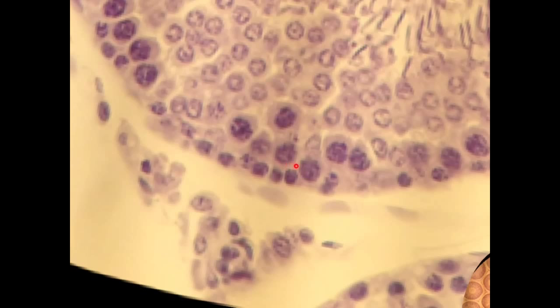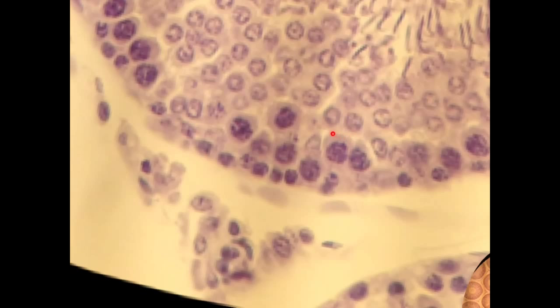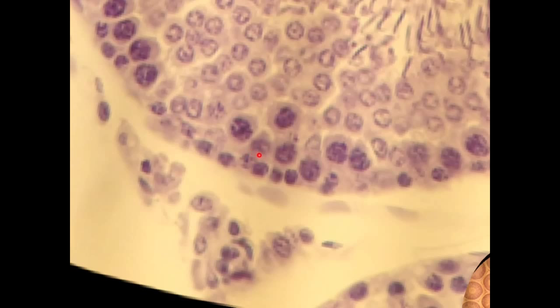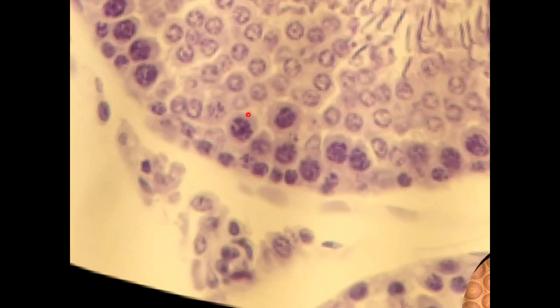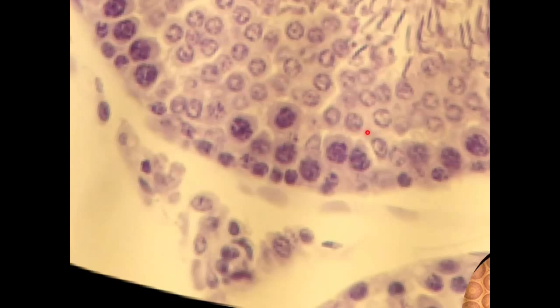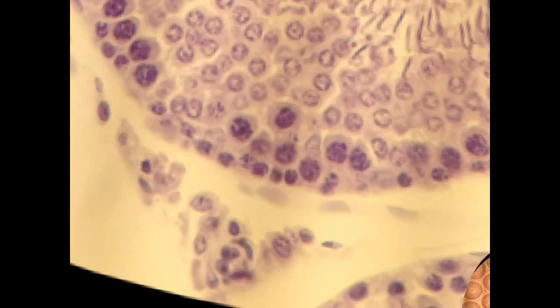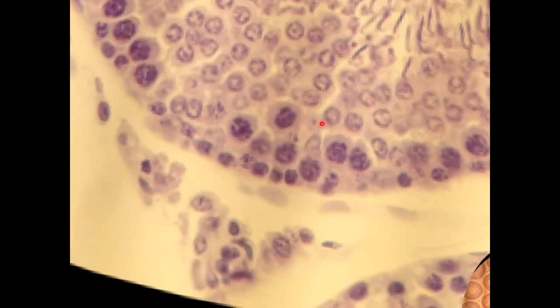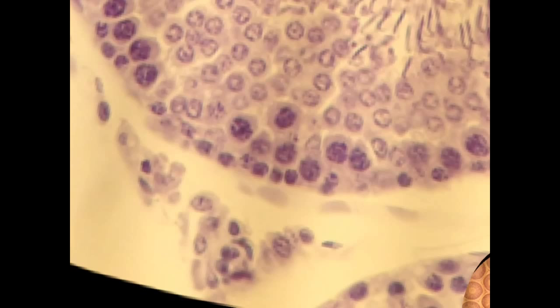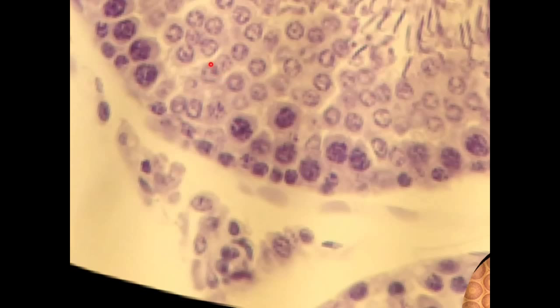The spermatogonia are going to divide and produce what are called primary spermatocytes, which are the next layer of cells in. These cells have a very dark nucleus — they were producing that very dark ring around the outside because primary spermatocytes are still diploid. Those primary spermatocytes will develop into secondary spermatocytes, and that's where you'll see a much lighter nucleus because now there are half as many chromosomes, letting in a lot more light. So those are the three layers of spermatogenic cells: spermatogonia, primary spermatocyte, and secondary spermatocyte.